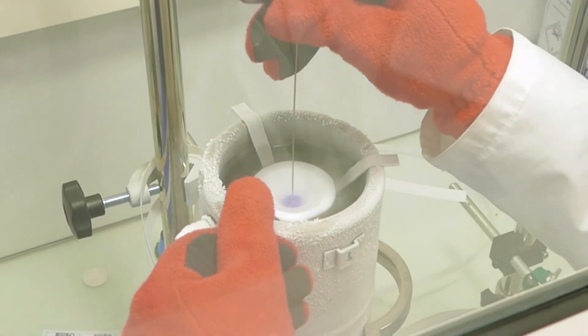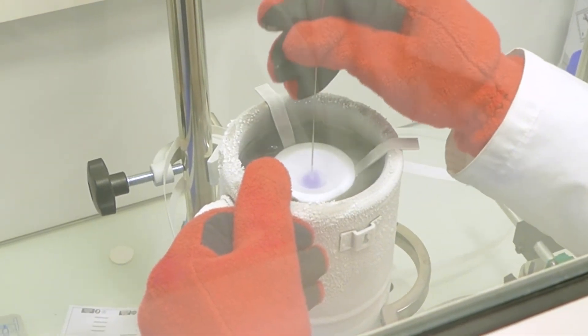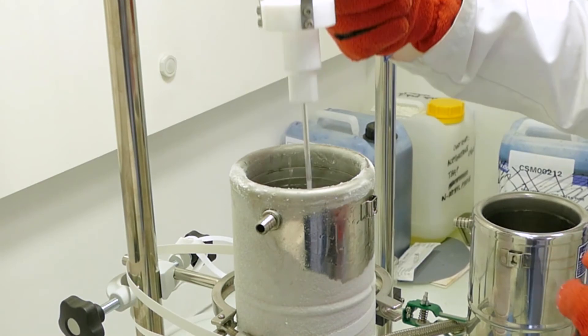Use the packing tools to push the ice into the EPR tube. Pack gently to get about 1-2 cm of powder at the bottom of the tube.